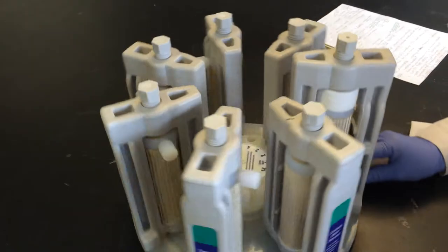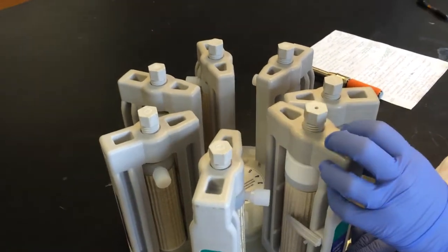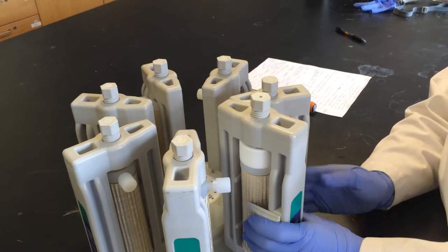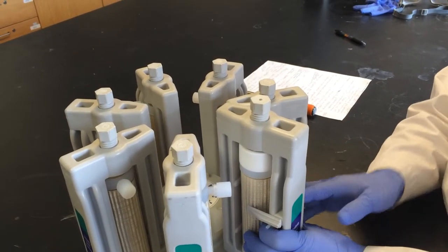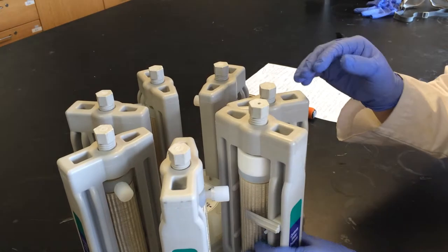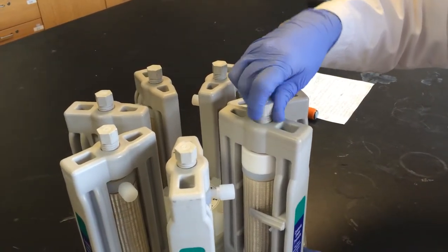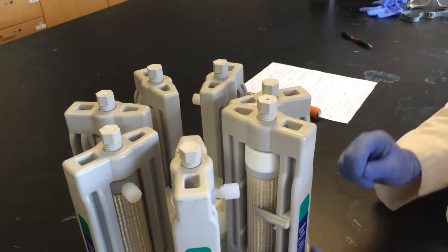Also, you want to make sure in your control vessel, which is the tallest one, that you have the same type and amount of solvent in this glass tube as you have in your reaction. This screw on top is only hand tightened. It is not cranked.